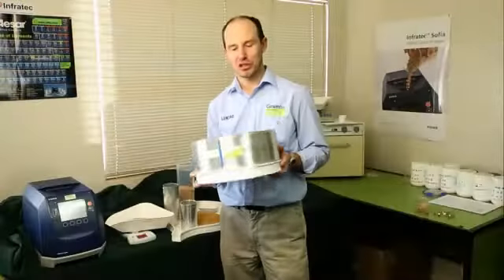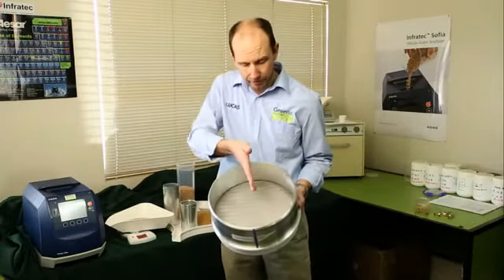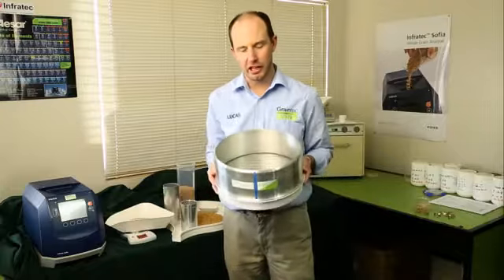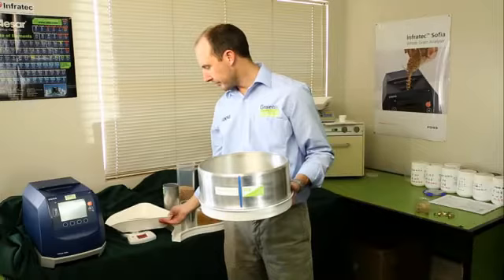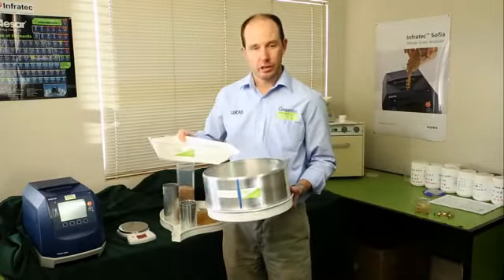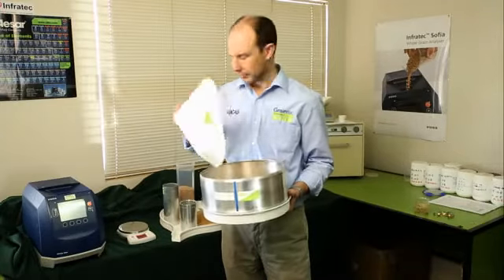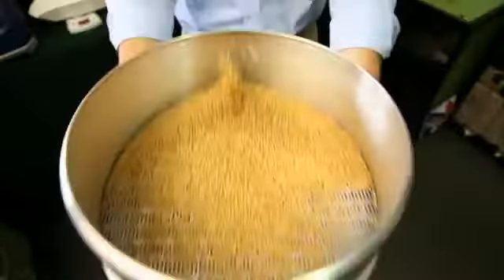It's important that when you shake your sieve, you make sure that the slots in the sieve run in the direction you shake it. So we're going to shake it in that direction. That's why we have a line on the front of the sieve. So the standard number of shakes is 40 shakes. We place our 500 mL sample in the screen. And then we shake it 40 times.